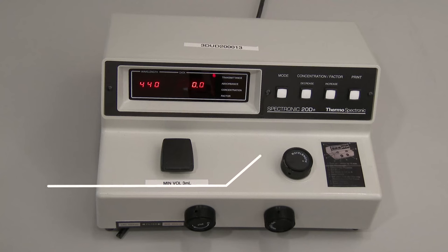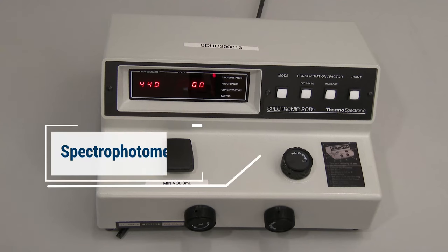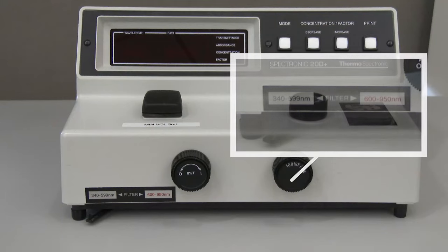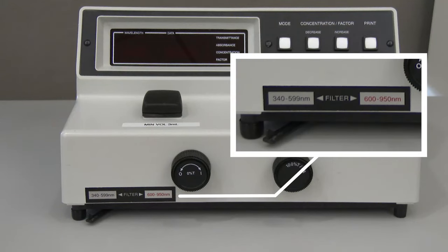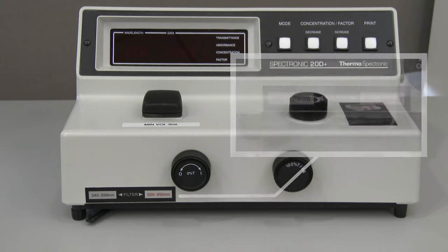For this video, we will be using a single beam spectrophotometer with a digital display. This instrument has a wavelength range of 340 nm to 950 nm and a nominal spectral bandwidth of 20 nm.